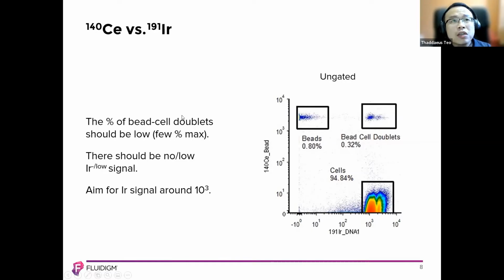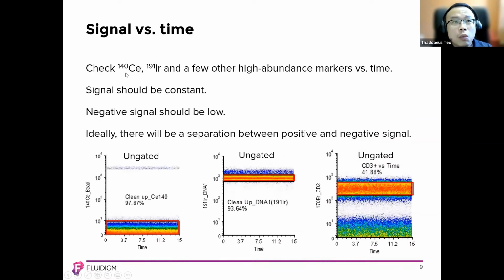And when you are checking signal over time, do check the 140, 191. Make sure the other abundance markers versus time should be constant. There shouldn't be any negatives. The negative should be low or not at all. Ideally, there should be separation between the positive and negative signal like this. You can see that it's really clean cut between both positive and negative signal. So this is an overall good data view.